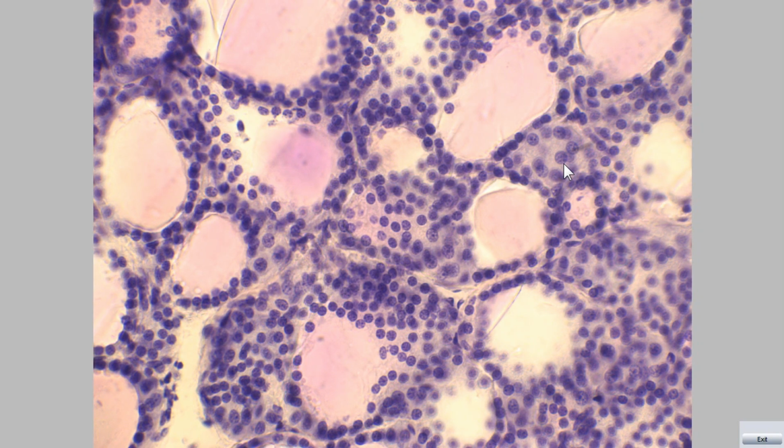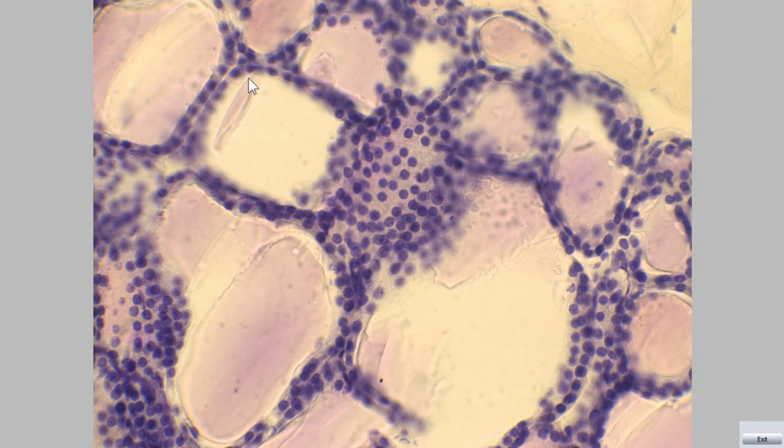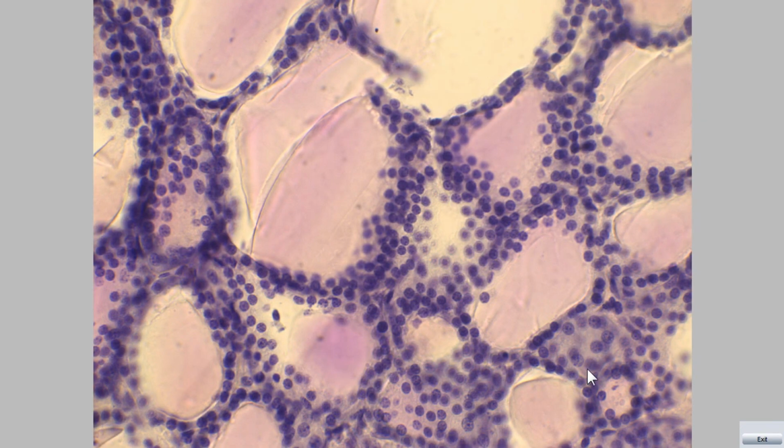These cells secrete which hormone? Calcitonin. Thyroid follicles: each follicle has simple epithelium and a central lumen with acidophilic colloid. These cells are called follicular cells or thyrocytes. In addition to these cells, we can see the parafollicular cells or C cells. These cells secrete calcitonin.